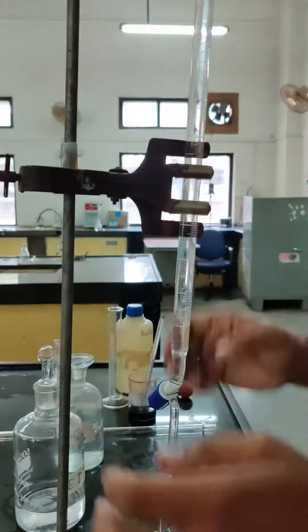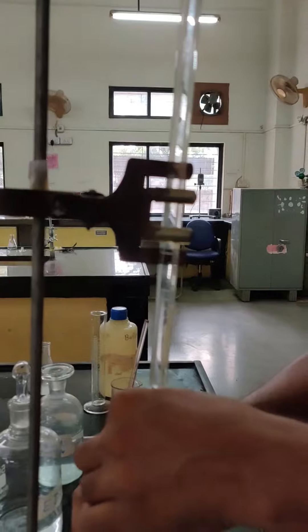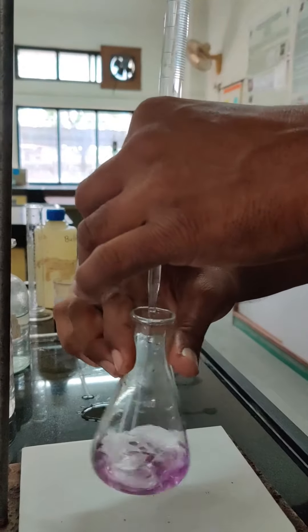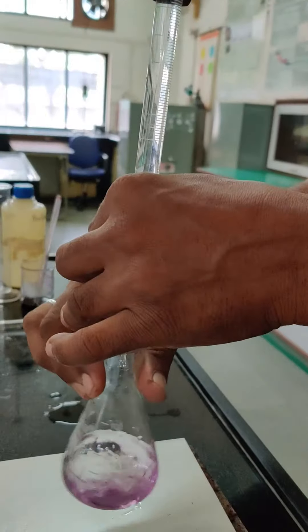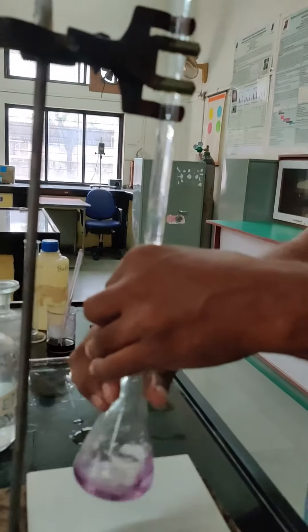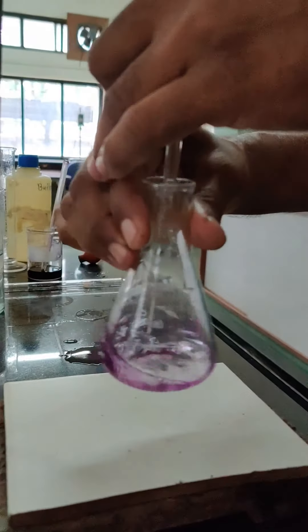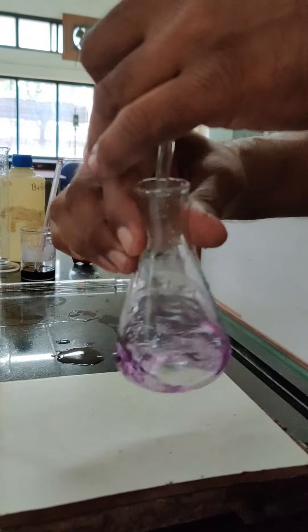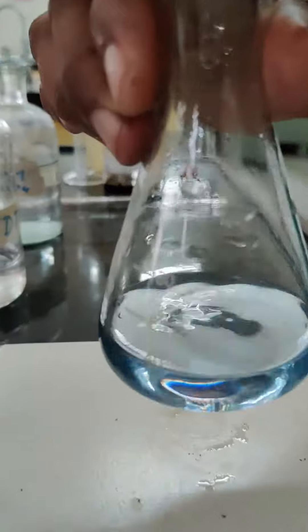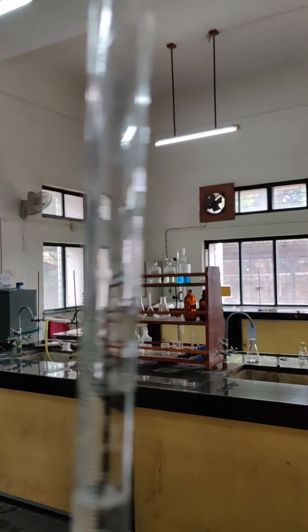The wine red colour confirms the metal-EBT complex formation. From the burette, which has been filled with the disodium EDTA salt solution, we start adding the EDTA solution to the conical flask, keeping on stirring, until we get the end point. At the end point, there is a colour change and you get blue colour. As you can see, the blue colour has appeared — this is the end point of the EDTA titration, and we note down the burette reading.